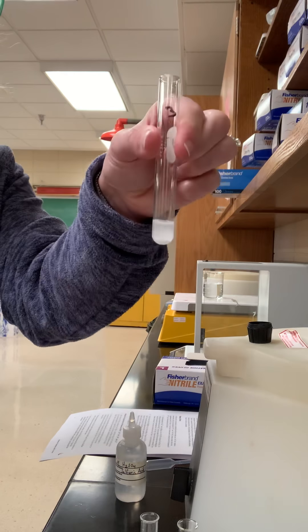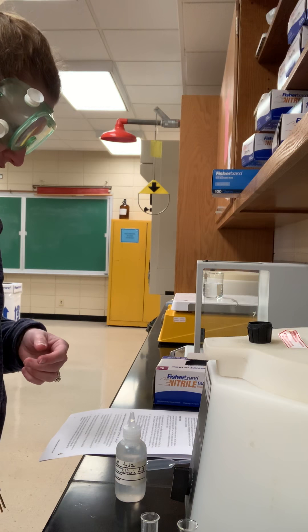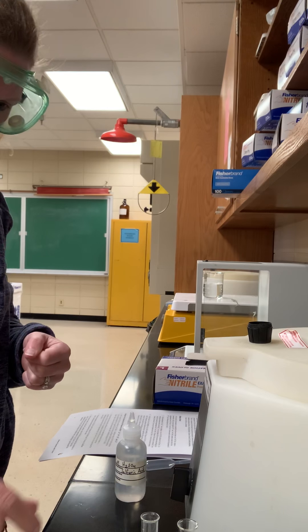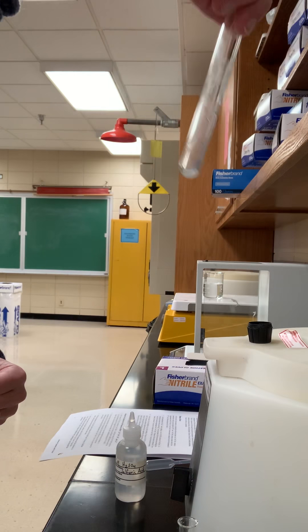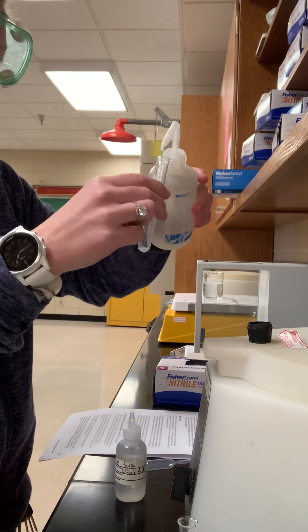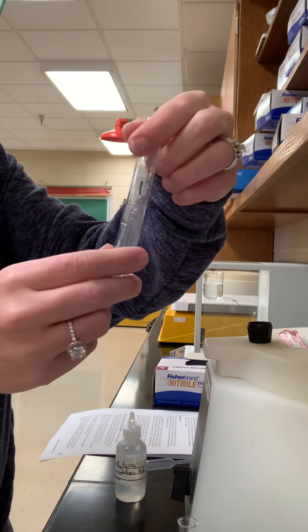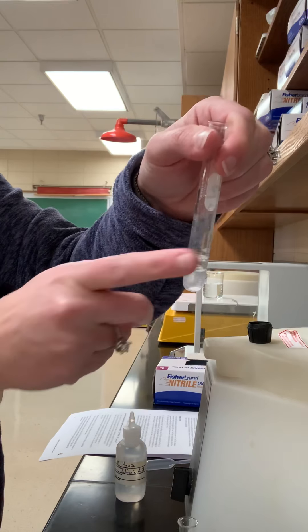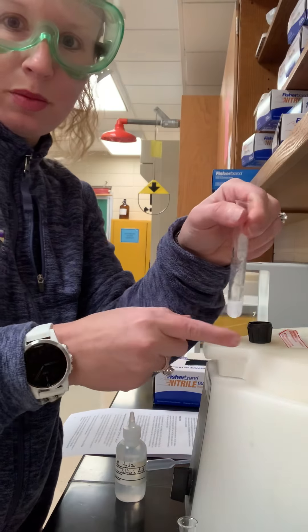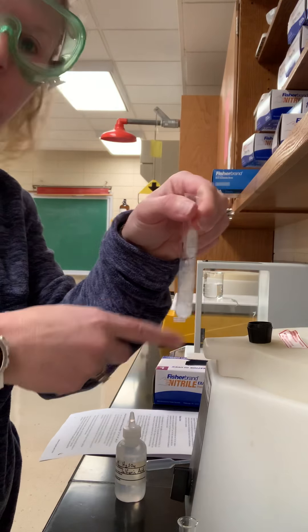So we know that this is here. Now it says go back to test tube one — which is what I just had — and repeat it. We've got to get all the lead out. Stir it up, test tube one. I'm going to repeat this and I'll be back for step 9.